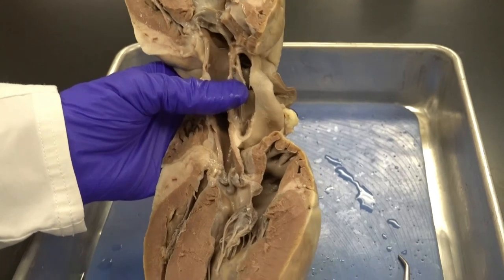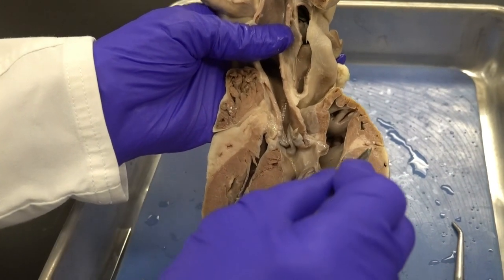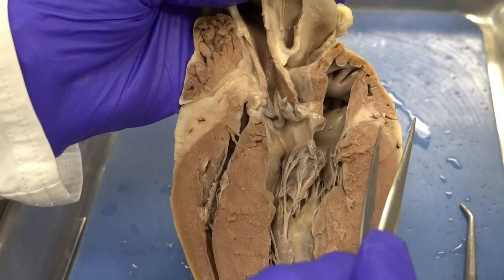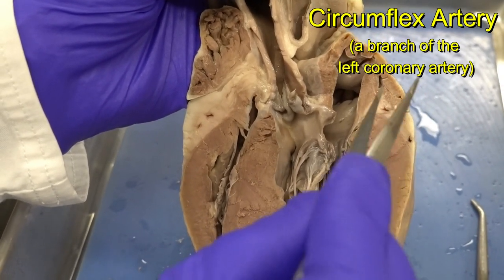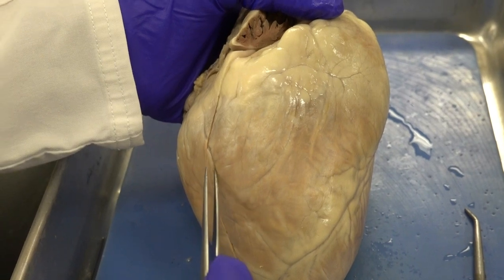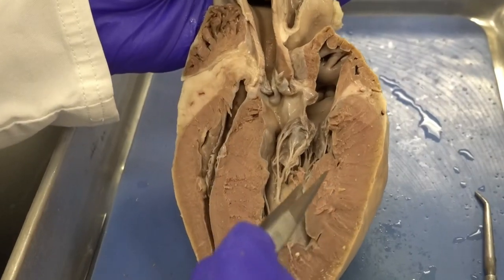Now I look at the branches of the coronary arteries visible internally. On the left side, between the left atrium and left ventricle, I find the circumflex branch — which supplies the left side of the heart with oxygenated blood. On the external view near the right ventricle, I can see a shadow of the marginal artery, which supplies the right ventricle.